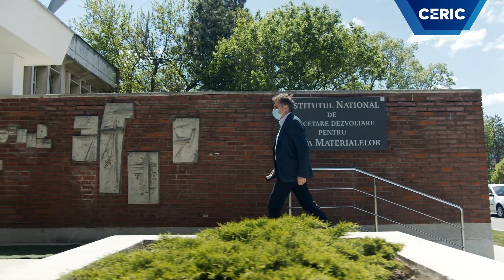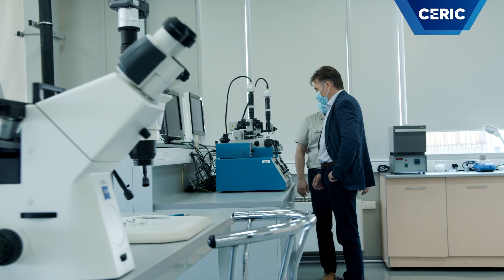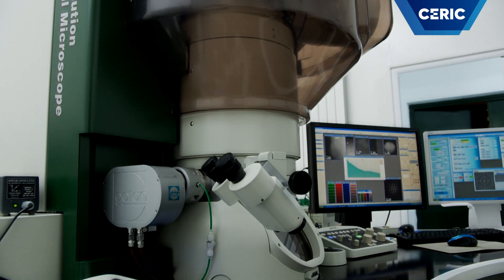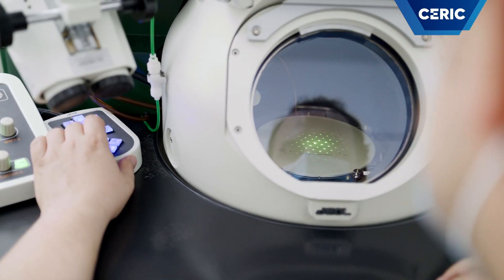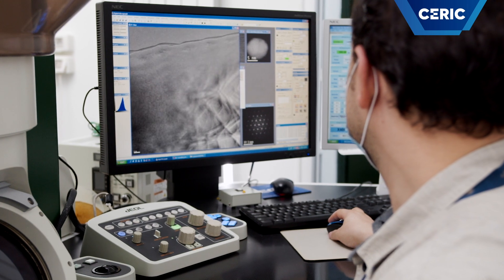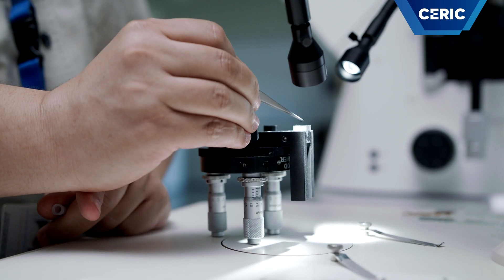In transmission electron microscopy, or TEM, we use a beam of accelerated electrons to study the internal structure of micro-objects. The instrument consists of several main parts: an electron gun, electromagnetic lenses for shaping the electron beam, and specialized detectors for recording the scientific data resulting from the interaction between the accelerated electrons and the thin specimen that they pass through. Therefore, specialized techniques have to be applied to obtain samples with a thickness of a mere few tens of nanometers.